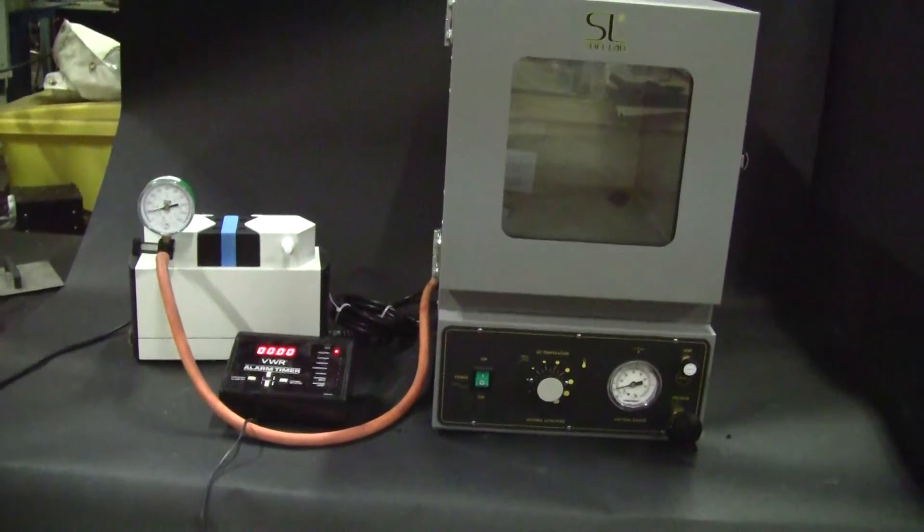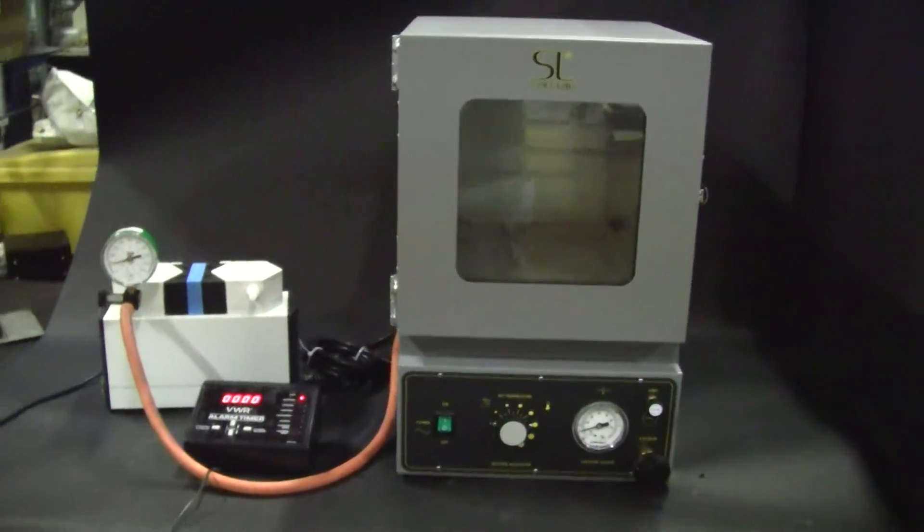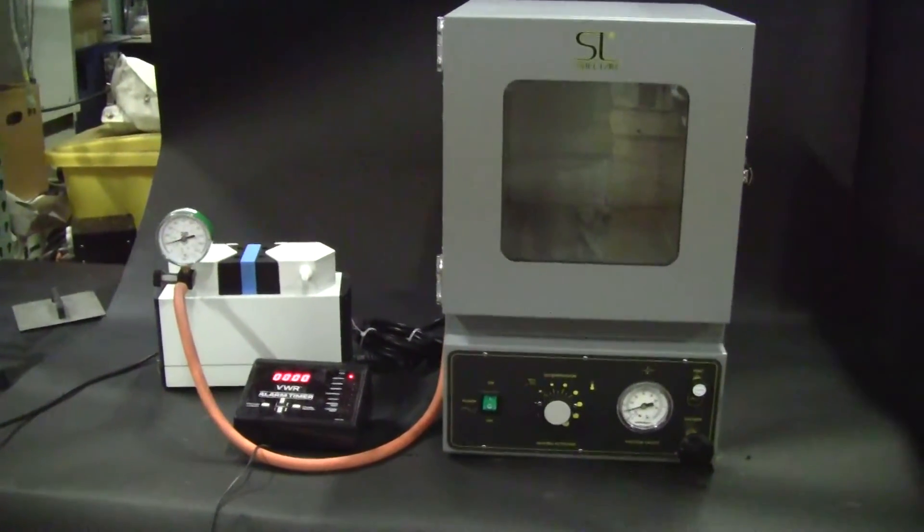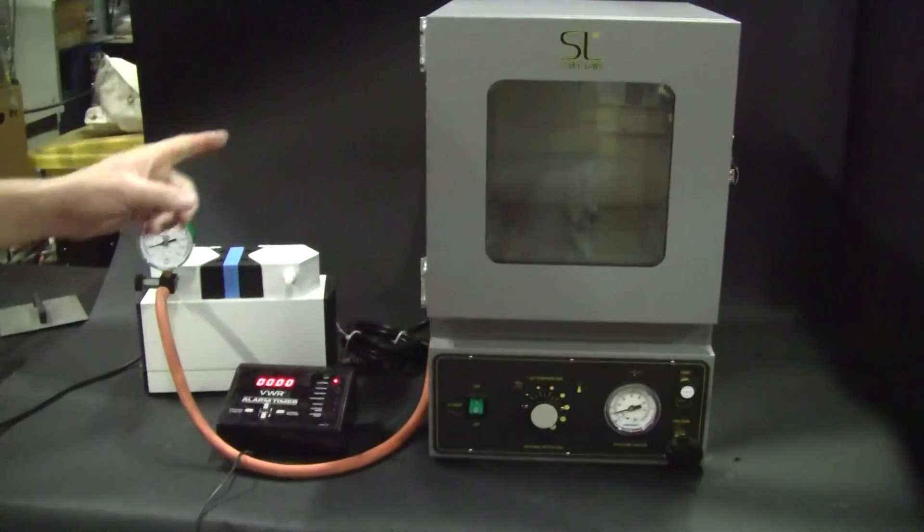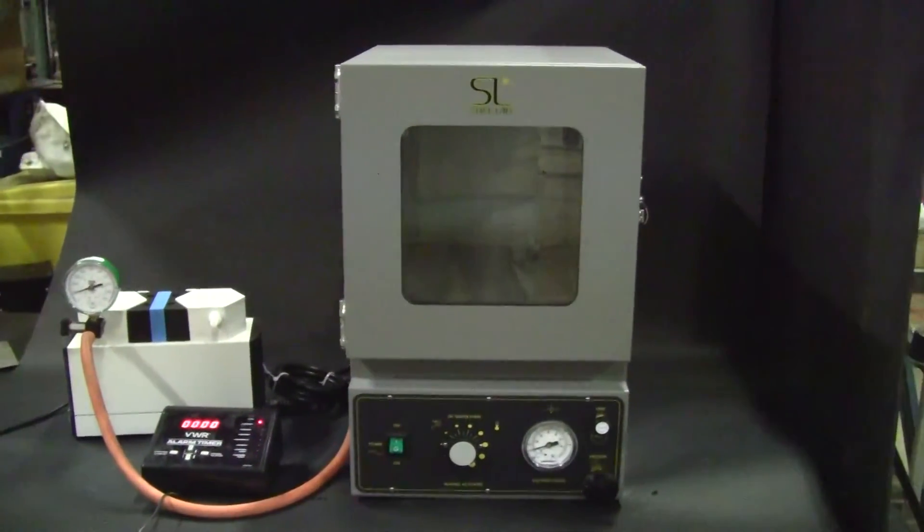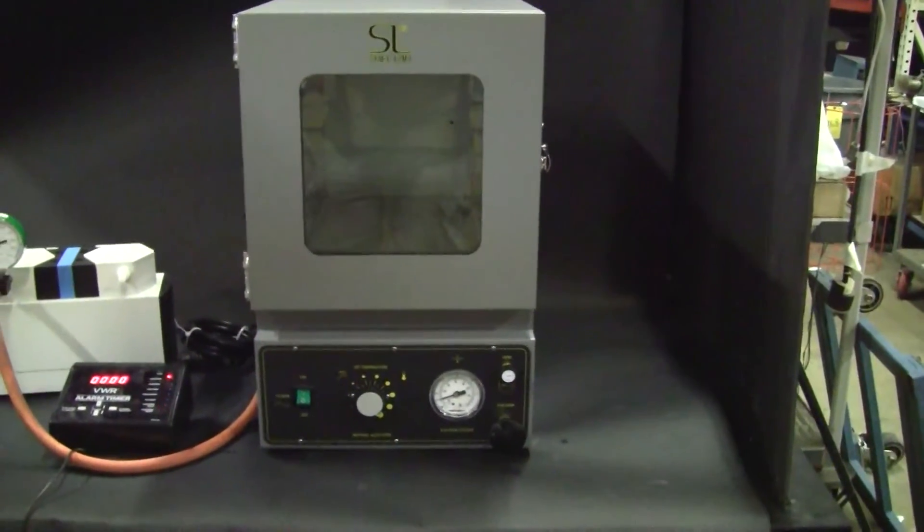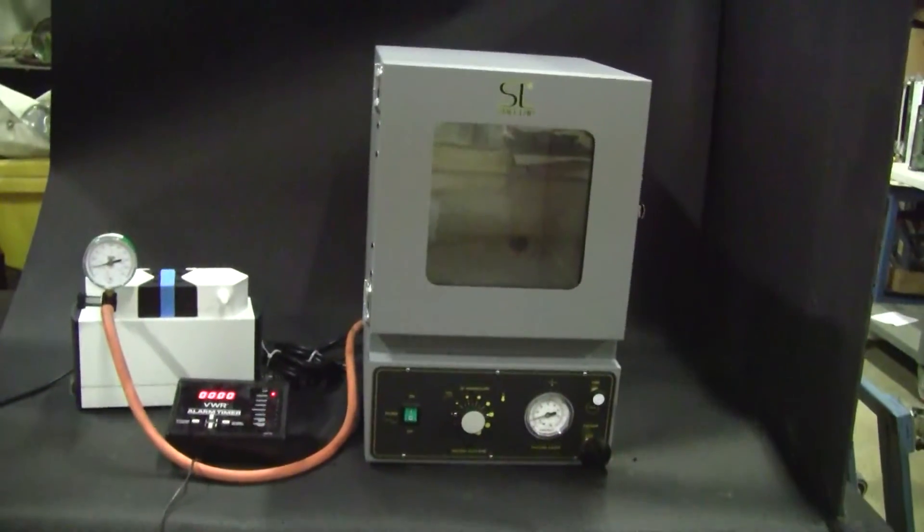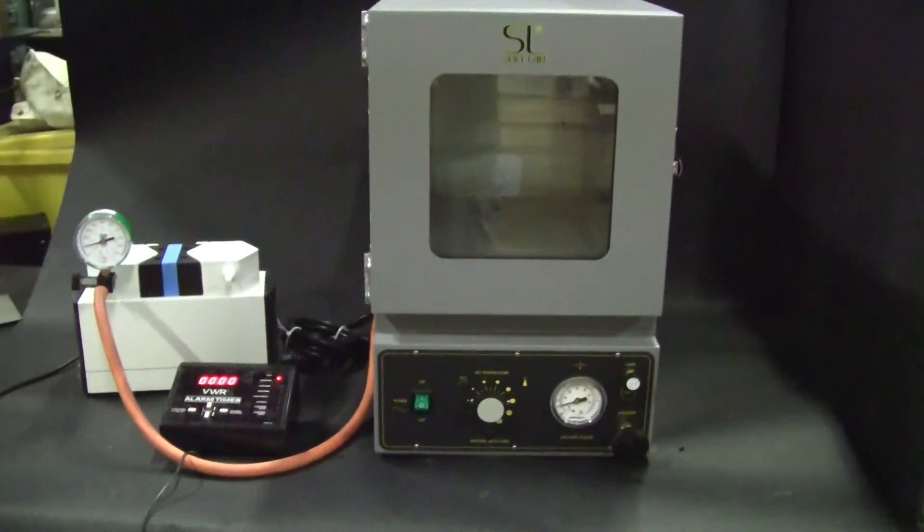What I'm going to do is release the vacuum from the chamber, seal the chamber up, and then time how long it takes for this vacuum pump to pull down that chamber. We're hoping from previous experiments that it takes about 2 minutes and 30 seconds, but we shall see.